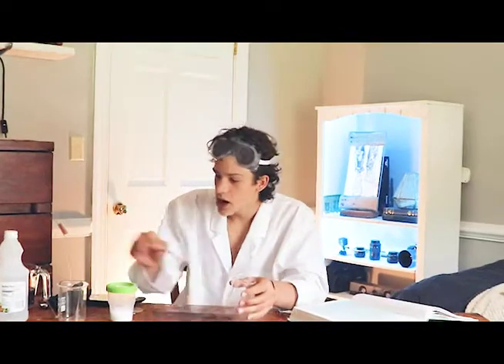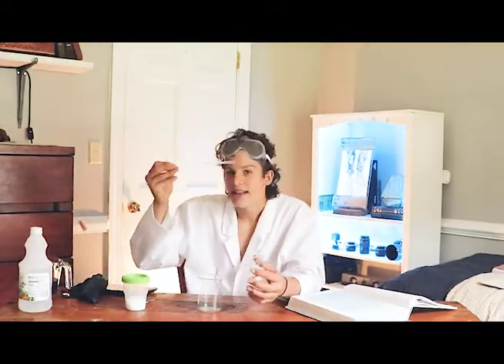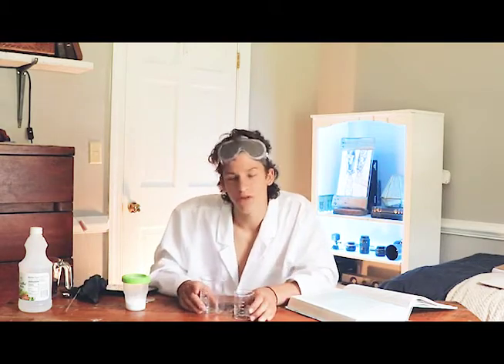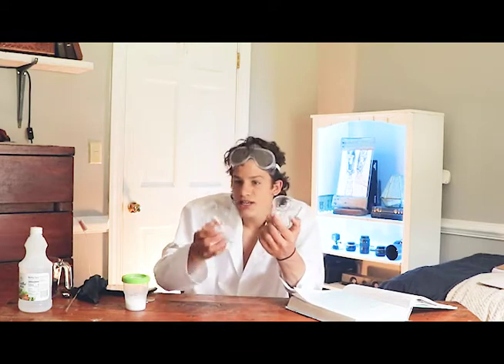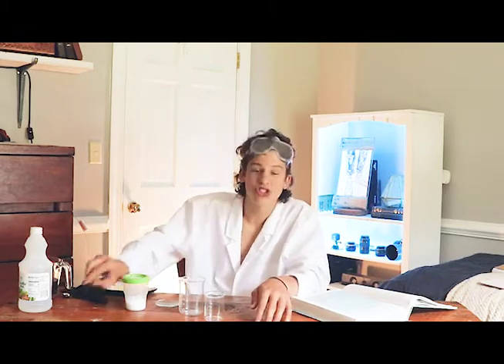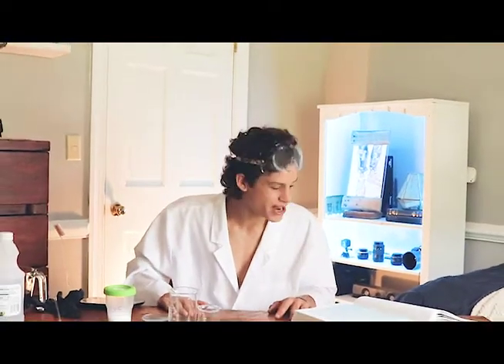If you don't have fancy glass beakers and stirring rods, that's not really a problem — that's what your mind's for. This is the time to be resourceful. If you don't have a beaker, use a glass jar. If you don't have a watch glass, use a porcelain saucer. If you don't have a stirring rod, use a spoon. That's the kind of thing that makes great scientists — no excuses. Let's move on to the actual experiment.